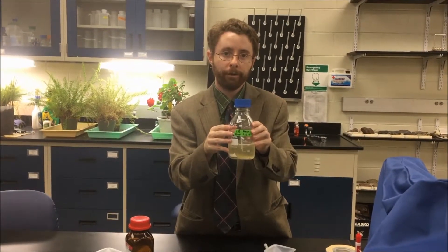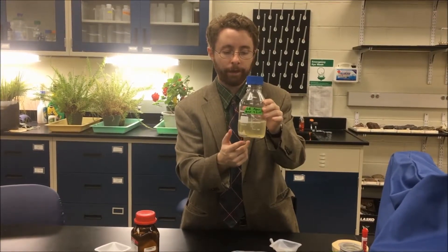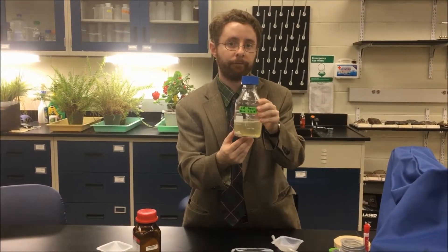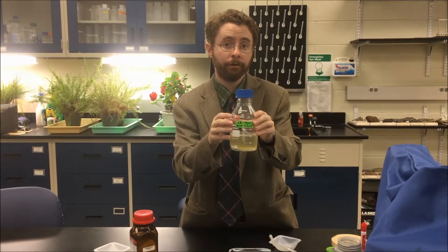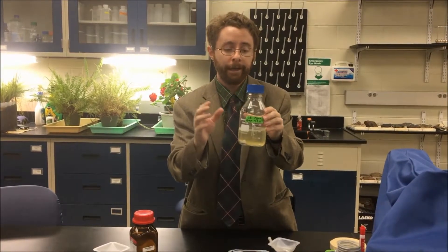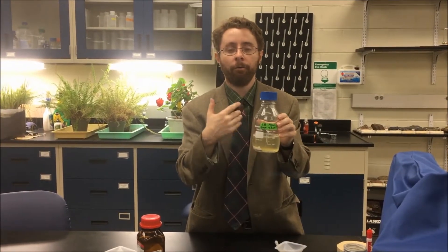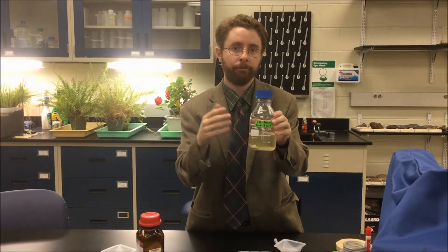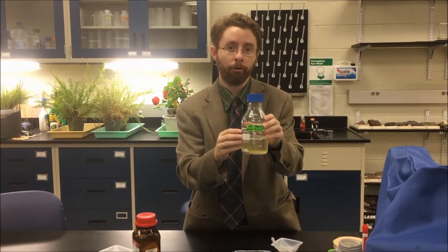After it is autoclaved, the agar and the LB powder that I've added will dissolve, and then this will sit in a water bath until I can easily handle it. If I want to add antibiotics to my media or any other indicators, those are always added after autoclaving, because the antibiotic will break down if it is added before autoclaving.